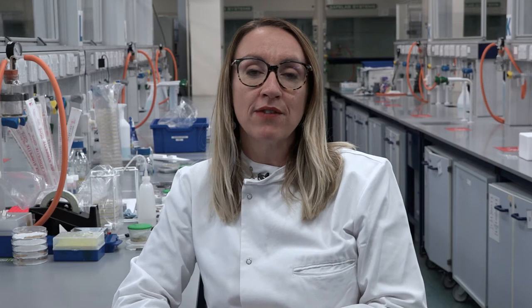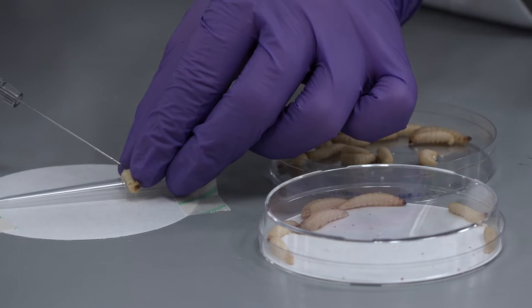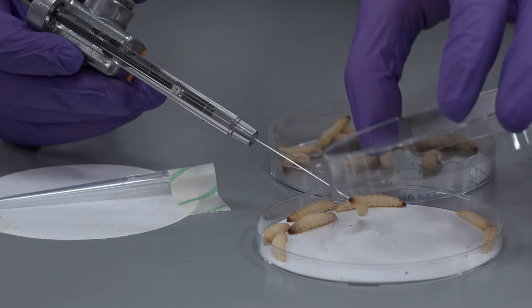It's important to have carried out the basic injection training before carrying out this protocol. Larvae can be adopted as a screening tool for drug discovery or repurposing by investigating the impacts of drugs on the survival of model pathogens and determining if they give the expected shift in survival.